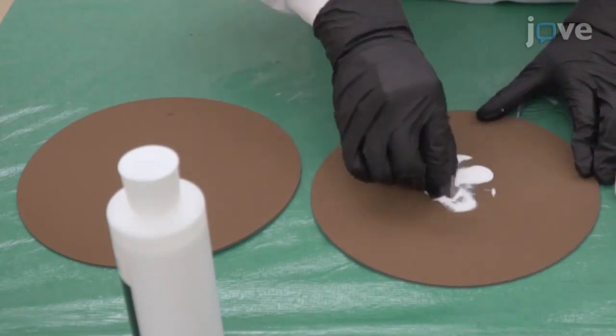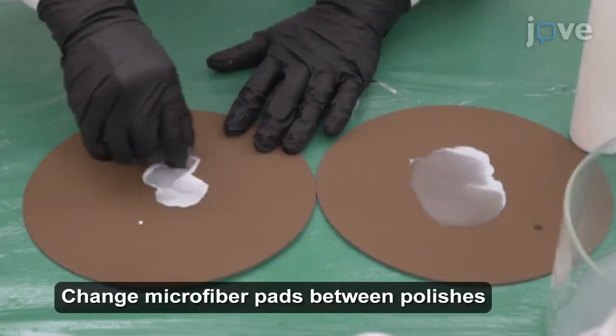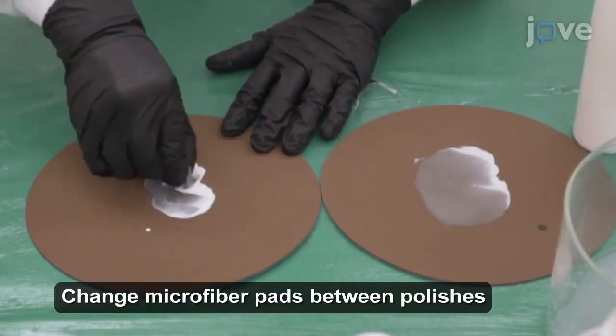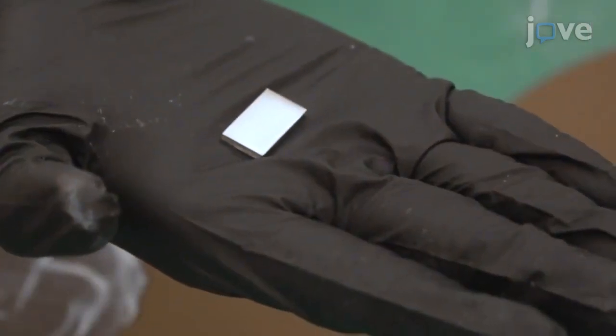Then polish the surface with 0.3 and 0.05 micrometer polishing suspensions until a mirror finish has been achieved.